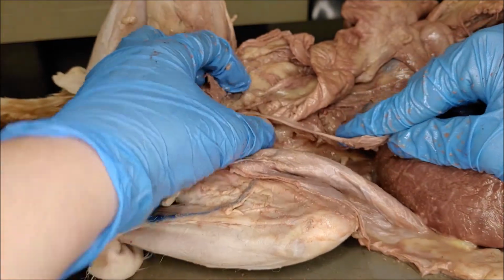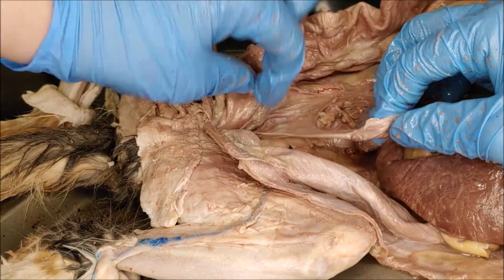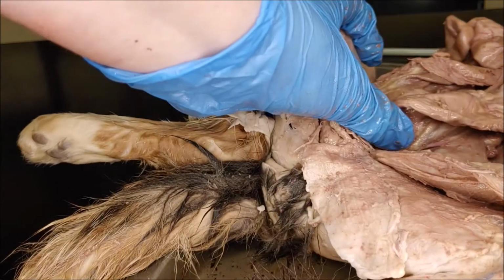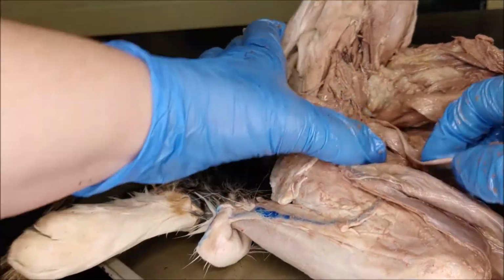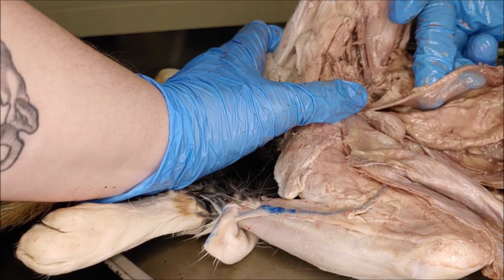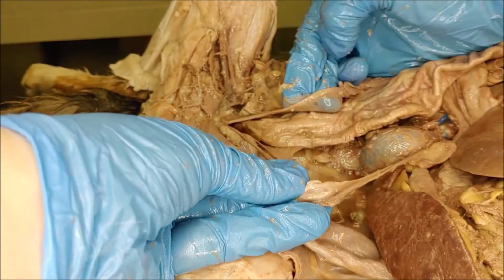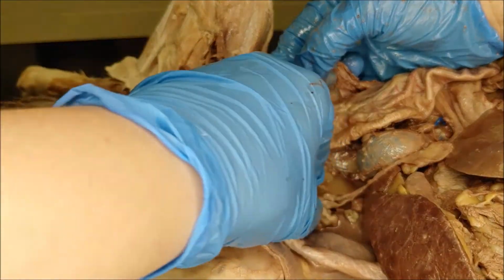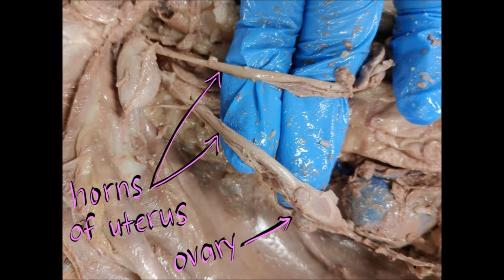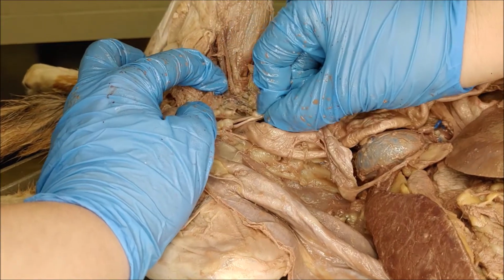So the cat that I happened to grab was a female, so we will look at the female reproductive system first. So this is a single horn of the uterus, and then the ovary is at the very end there. The reason the cats have this shape of a uterus is they have these two what are called horns on either side, and this shape allows for the cats to carry multiple young at once. So this is why cats can have a litter of 3, 4, 5, 6 cats, whereas a human uterus, which is shaped very differently, tends to only have one birth at a time.